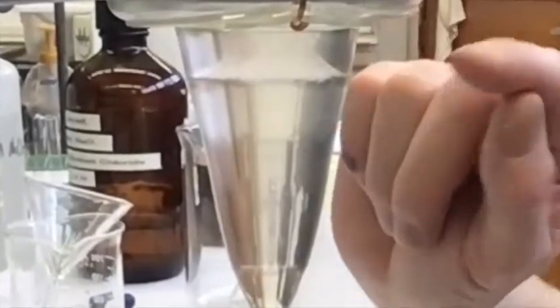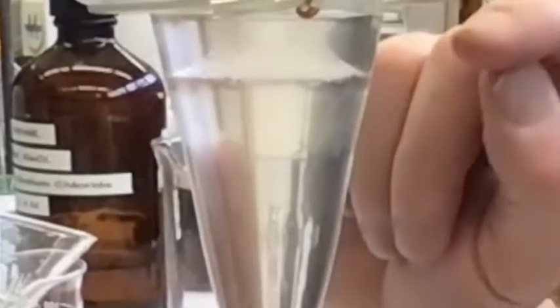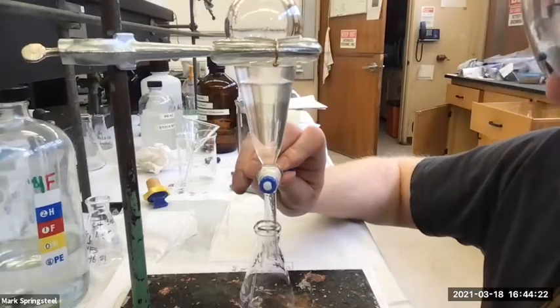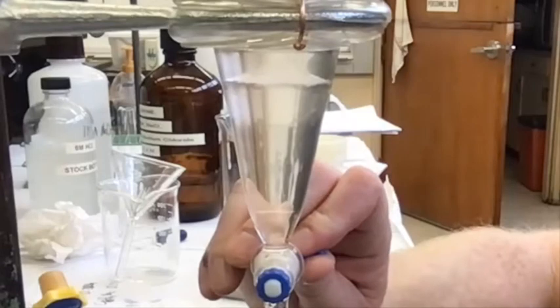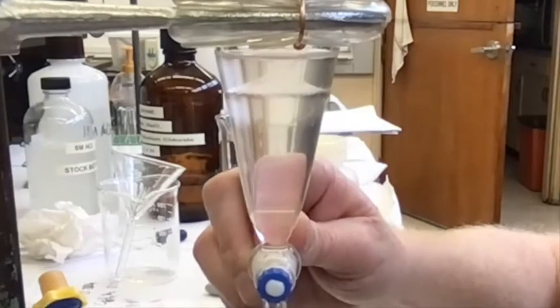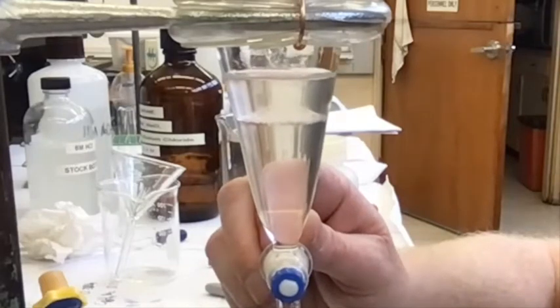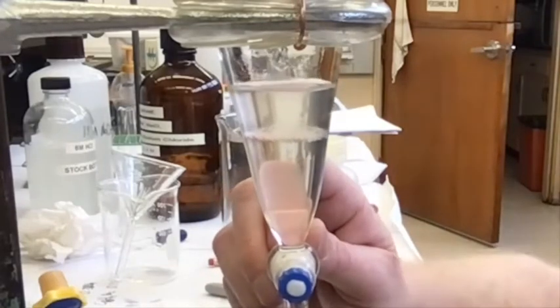For some reason, some sort of polymerization will take place, and you'll see that kind of shape a lot of times. You can see it a lot of times between the two layers, this thin polymer. Or can you see it, John? I can't. It's like a thin hourglass. Yeah, it's interesting, huh?